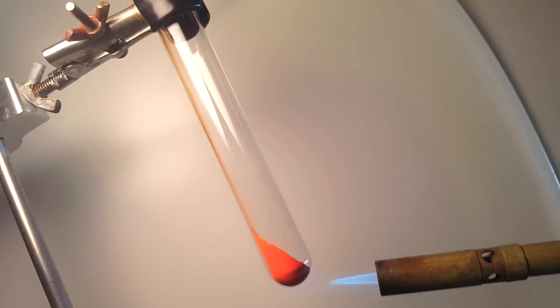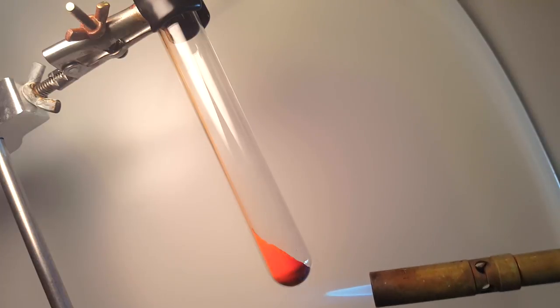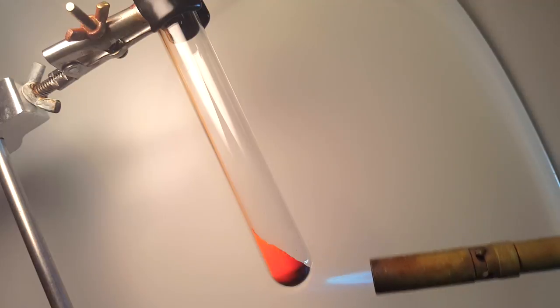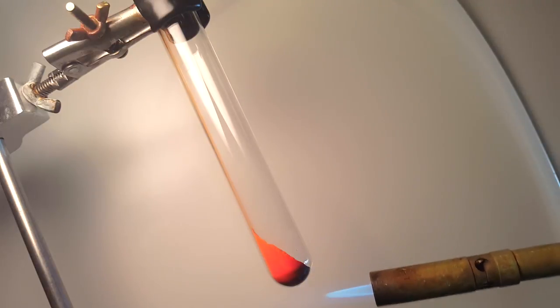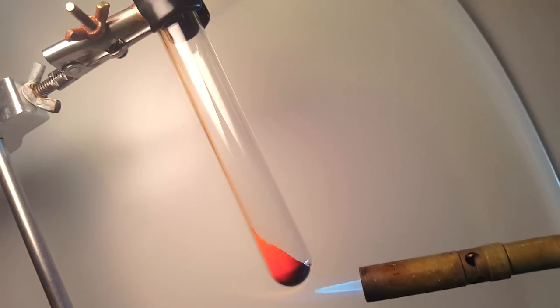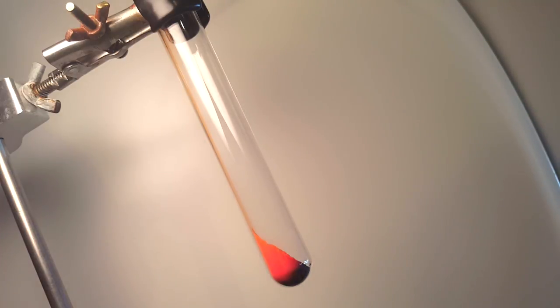At first, not much is happening. Slowly but surely, you can see the color change from the characteristic red to an almost black. I'm actually unsure why this happens, and I've found no research articles written on the matter anywhere. I'll go into my hypothesis on what's happening in a bit.